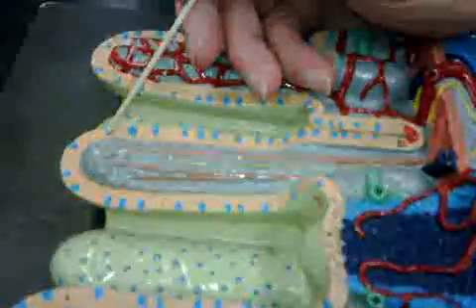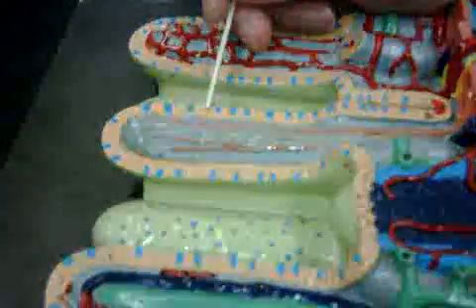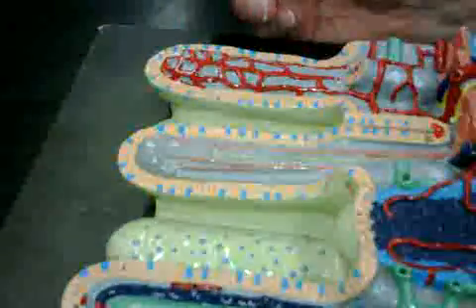Okay, all of these without the blue are columnar epithelium. The blue ones are goblet cells or mucus cells. So what is considered the columnar epithelium? All the cells that don't have blue in them.